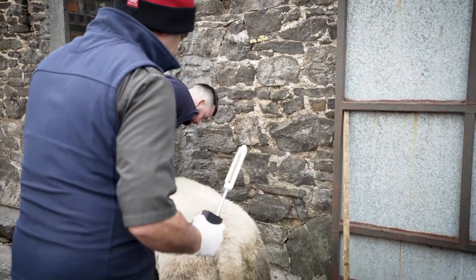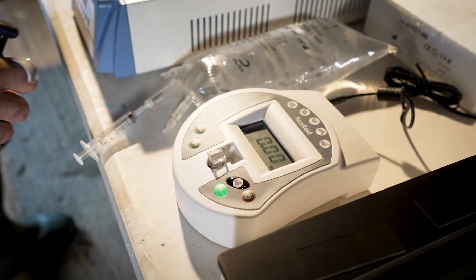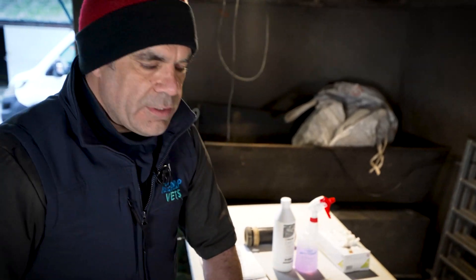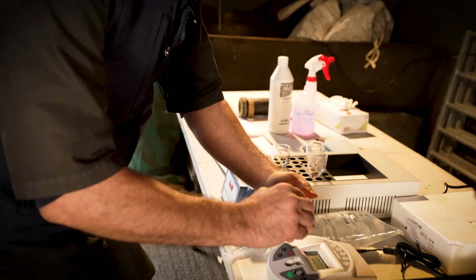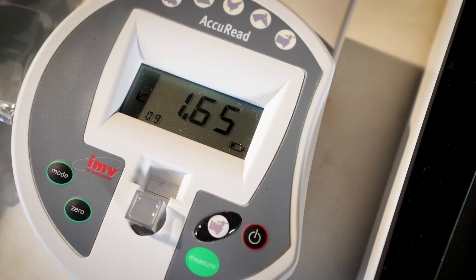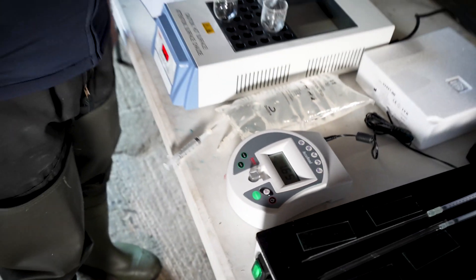This is a nice Texel. We shake the cuvette without touching the sides, very gently pull it out. We've got exactly four millilitres of normal saline — not just any water — and the semen sample. It's nicely mixed, not touching the sides, goes back in. This is a nice result — nicer. This is 1.65 billion. Billion. Good. It would be great for AI.